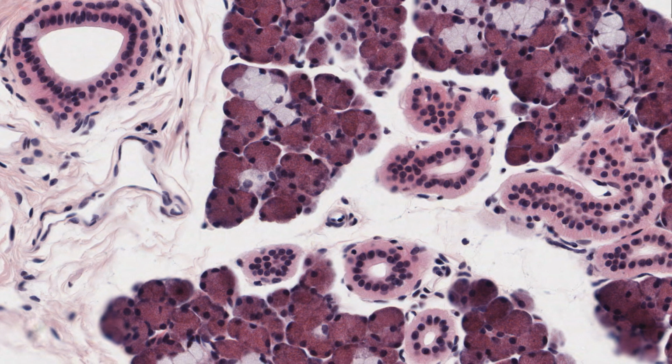If the epithelium of a tube has 2 or more cell layers, it is a stratified epithelium, such as you see here in this larger tube. You can clearly see that there is one row of cell nuclei stacked on top of another row of nuclei in this transverse section through this tube. Now, in addition to its number of cell layers, an epithelium is further classified according to the shape of the surface cells.